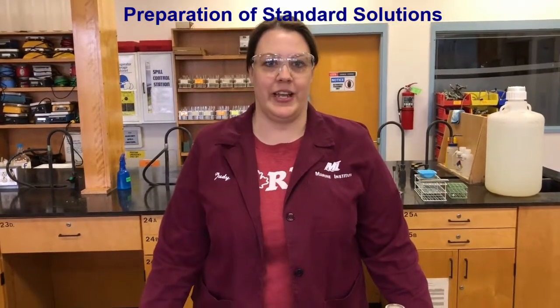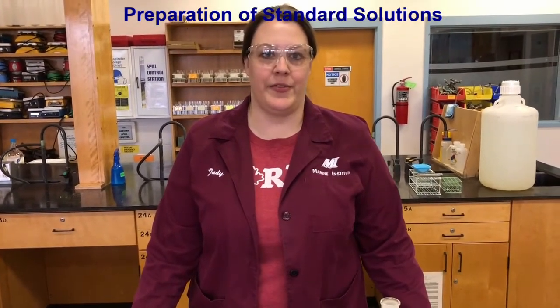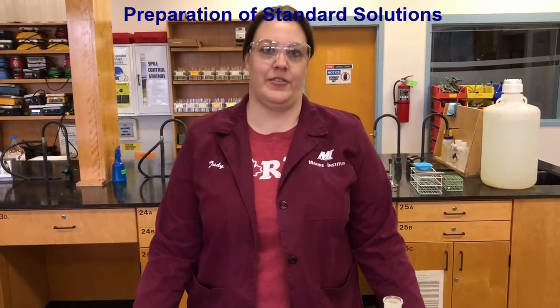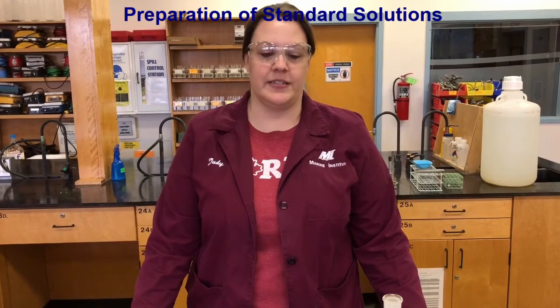Everyone, it's Judy here again, and I'm going to talk to you in this video about how to prepare standard solutions. So what is a standard solution? A standard solution is a series of dilutions of a substance that contain accurately known quantities or accurately known concentrations of that element or of the substance that they contain.